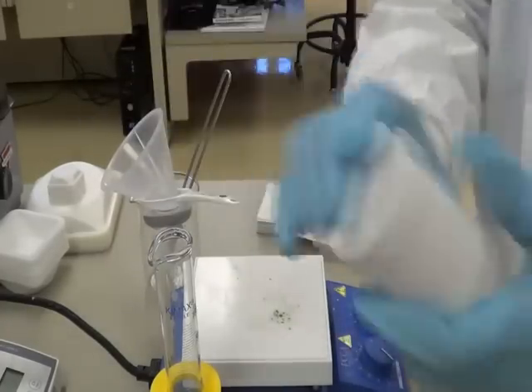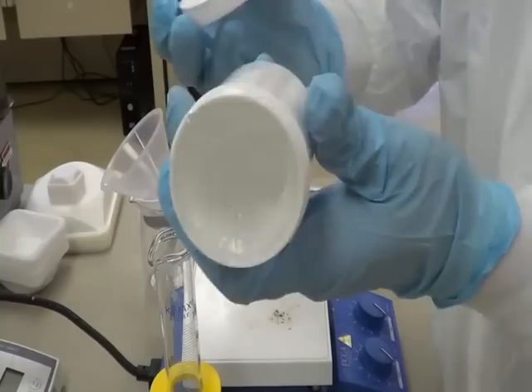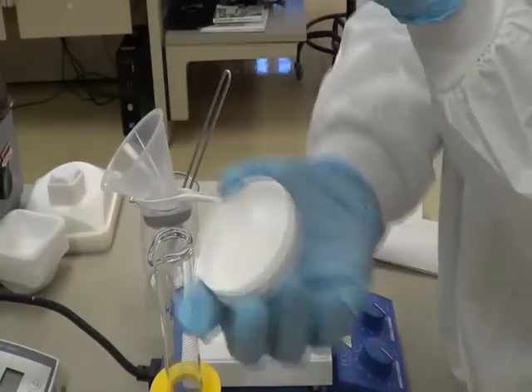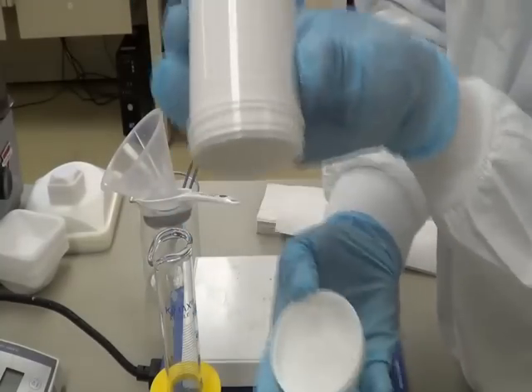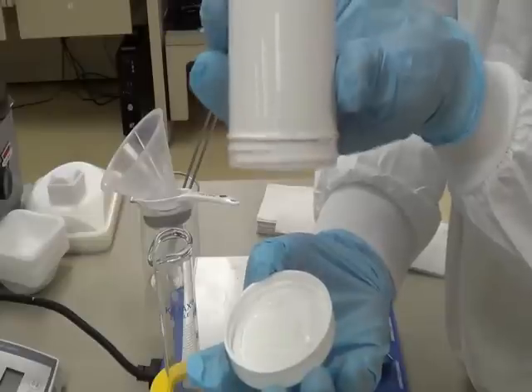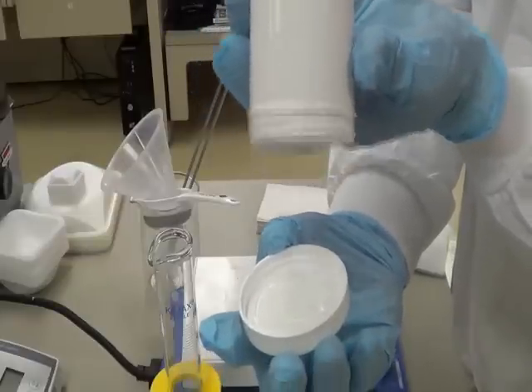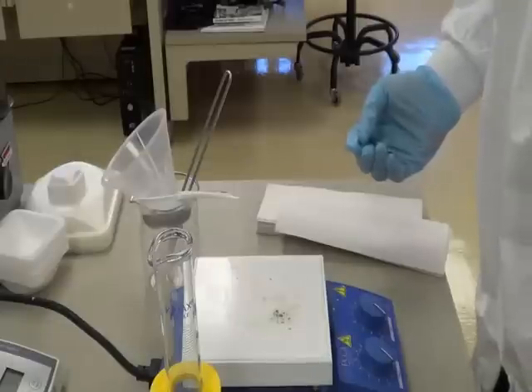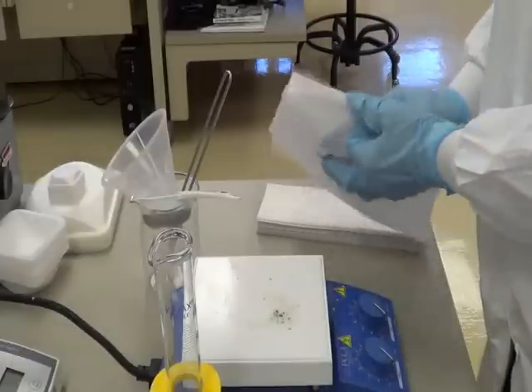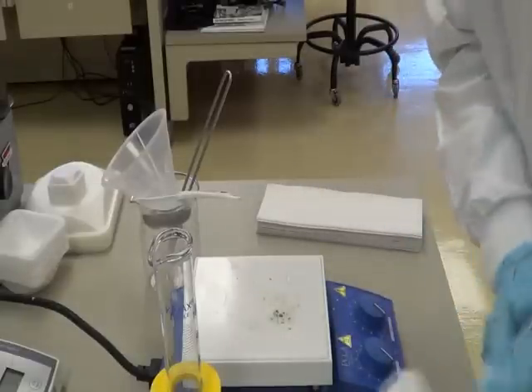Now see the magic — it is gel! Can you see that? Nothing is falling. It is gel. This is nothing but a hand sanitizer.